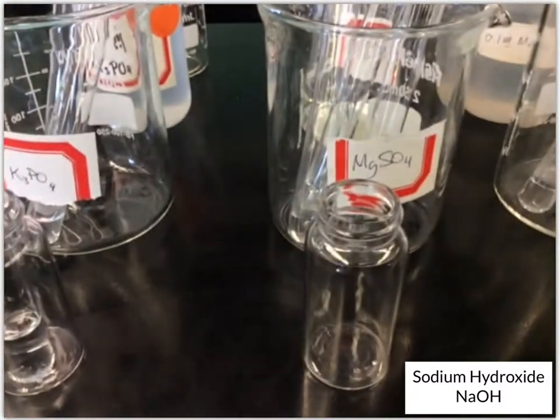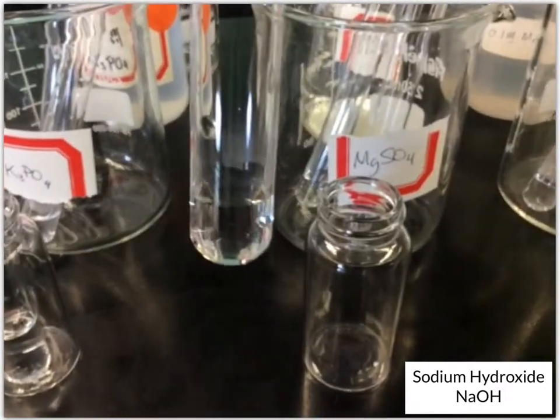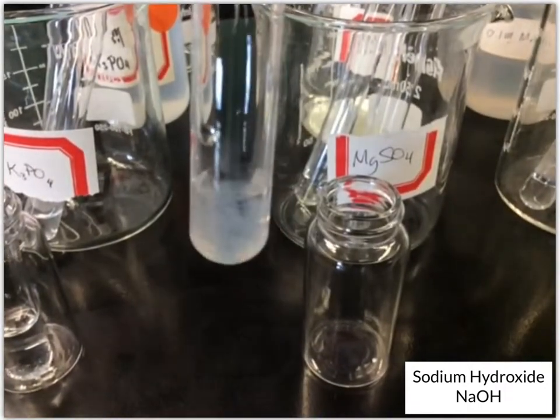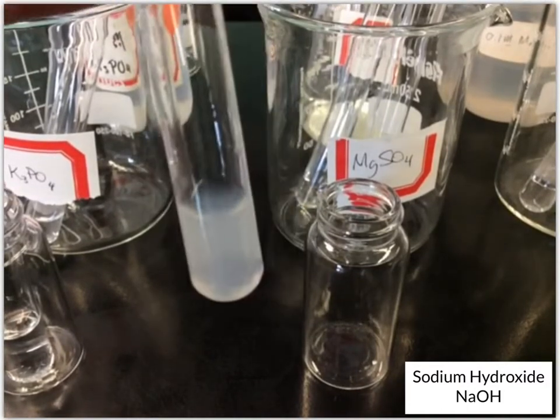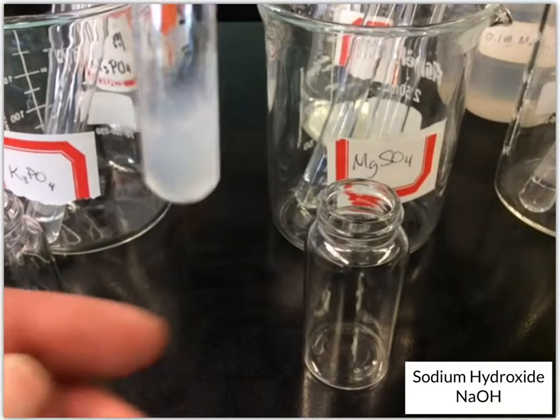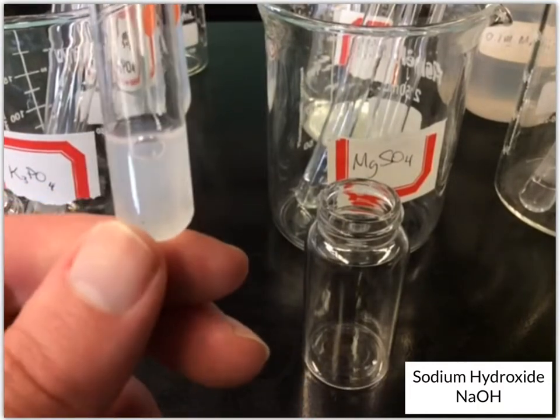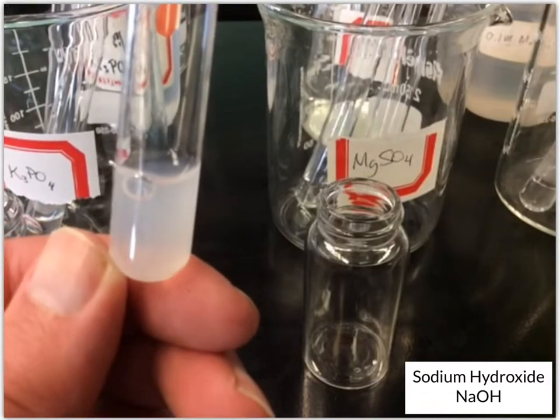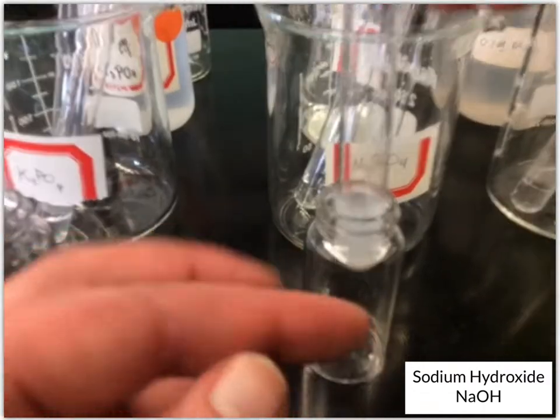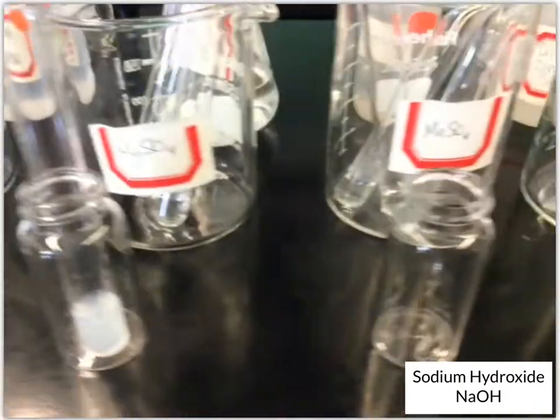Okay, next up, magnesium sulfate. Okay, now we got a white solution here too. So probably some solid. We'll let it sit a minute and see what it looks like after.